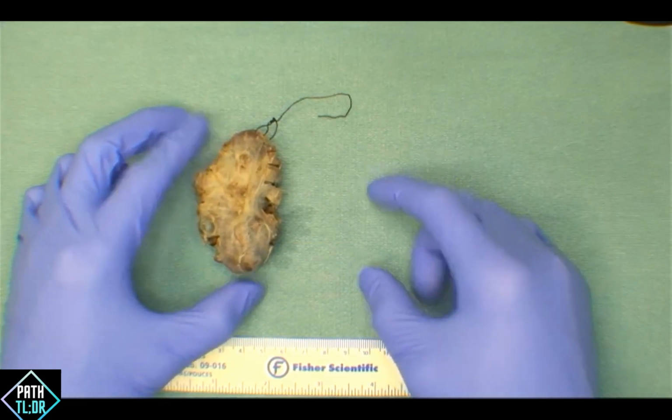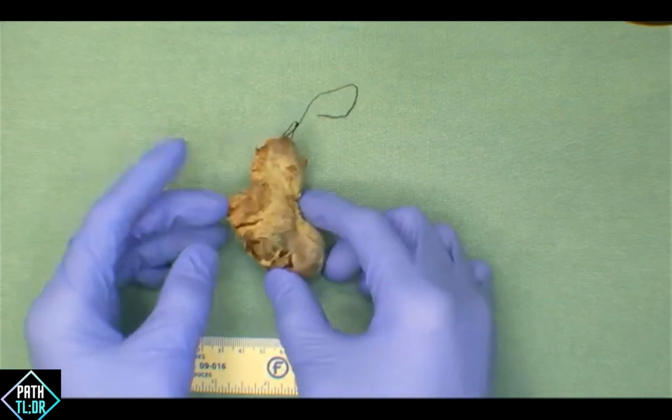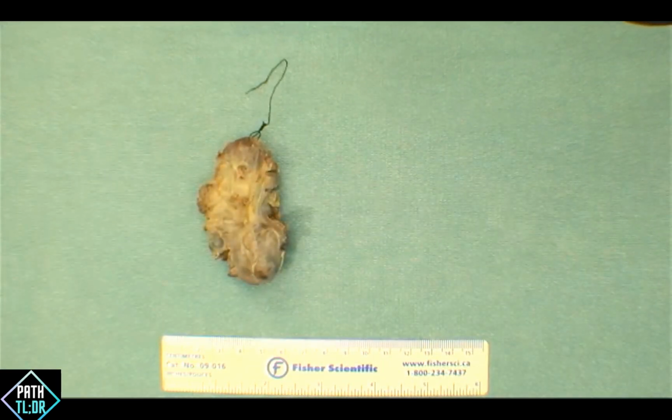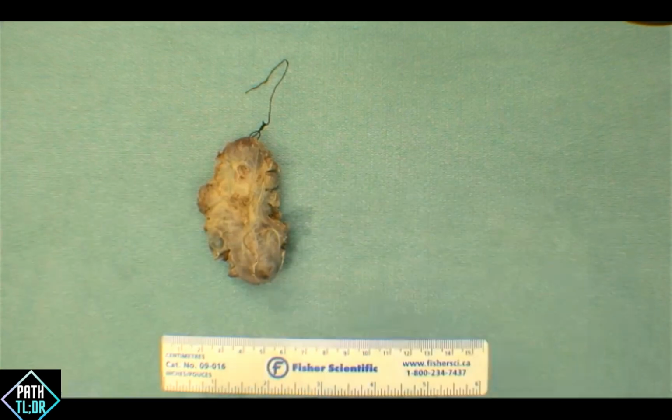Hemithyroidectomy would be what we see here, okay, and this would be a resection of one lobe plus part of the isthmus, which is probably just tucked into the side here. A partial lobectomy would infer that we're resecting a part of one lobe rather than the entire lobe. And an enucleation would be resecting just a thyroid nodule, depending on the nature of the pathology, and would basically pop out the tumor. Okay, so we're here looking at a hemithyroid.